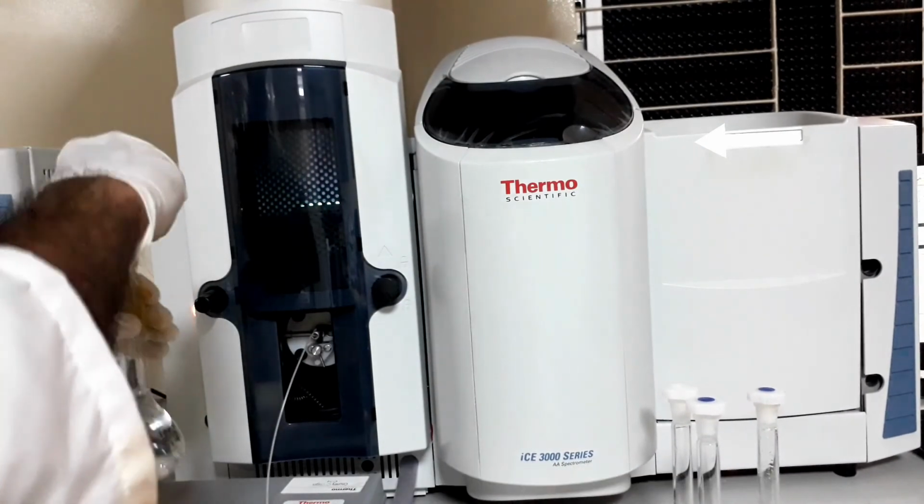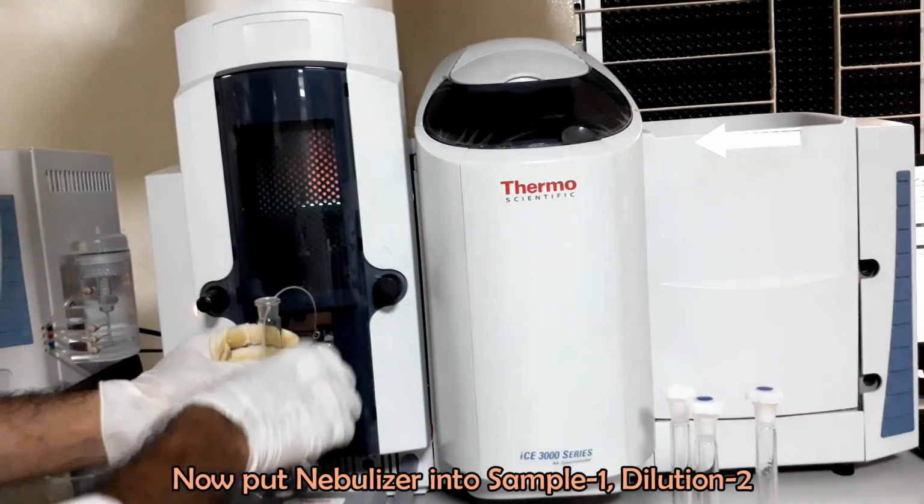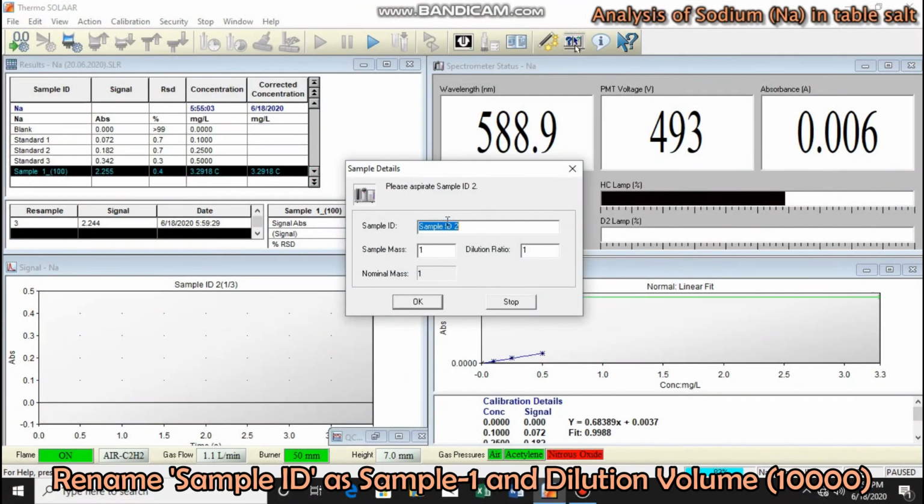Dry the nebulizer and insert it into the dilution 2 solution. Rename the sample ID and click OK.